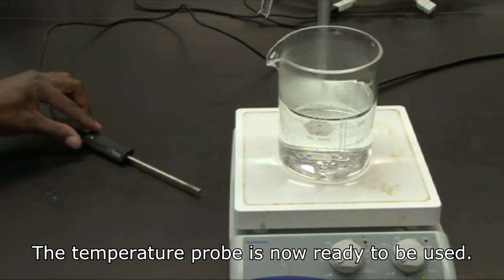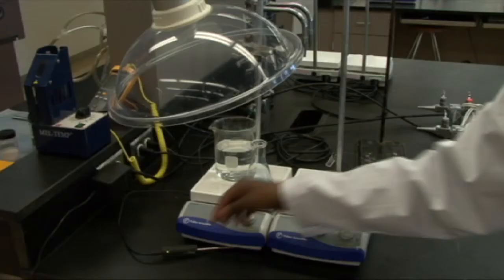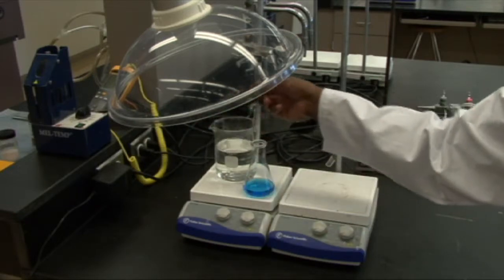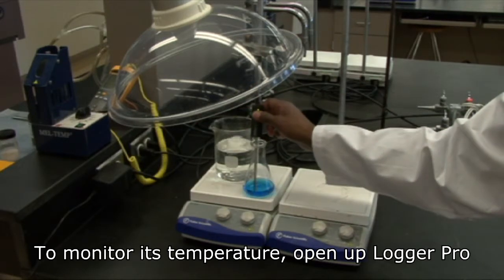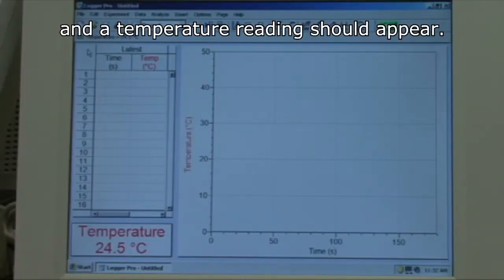The temperature probe is now ready to be used. Place it in the desired solution. To monitor its temperature, open up Logger Pro, and a temperature reading should appear.